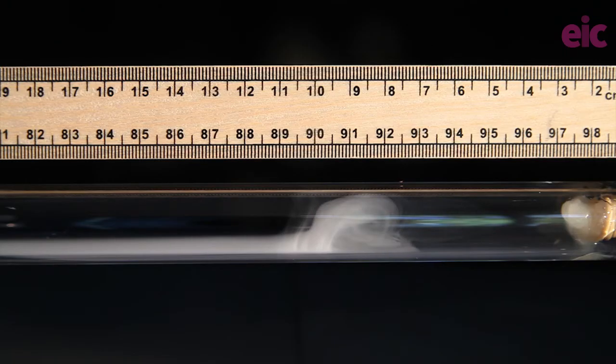This swirling maelstrom slowly pushes towards the HCl side, leaving a trail of increasingly tilted ammonium chloride rings on the walls of the tube.